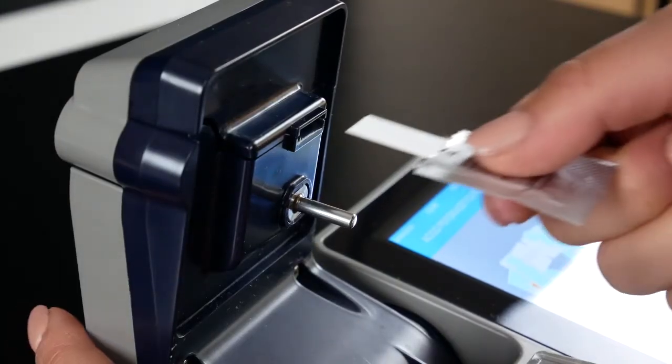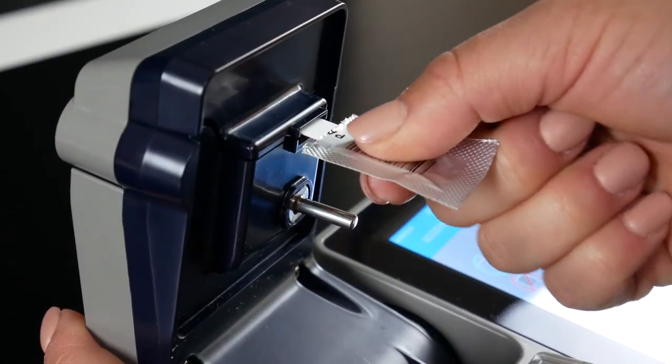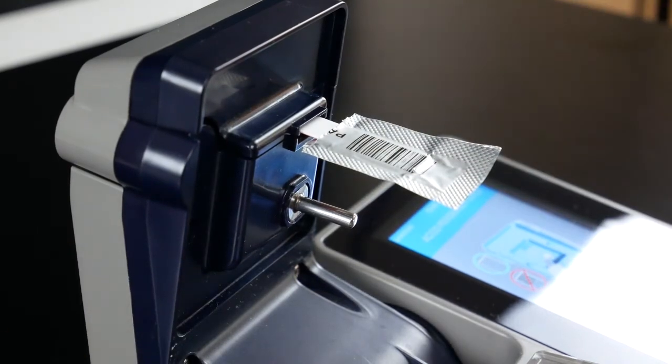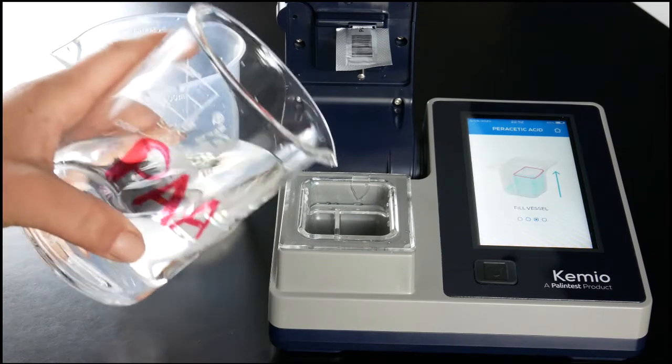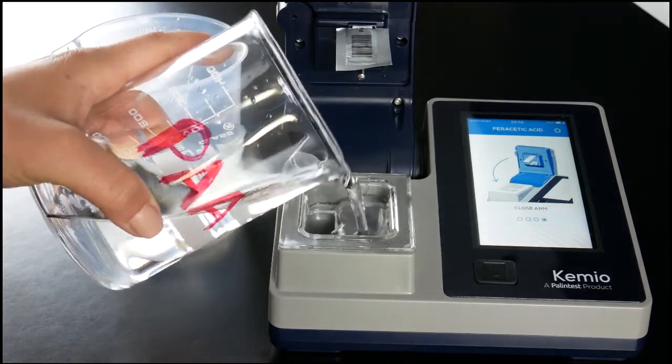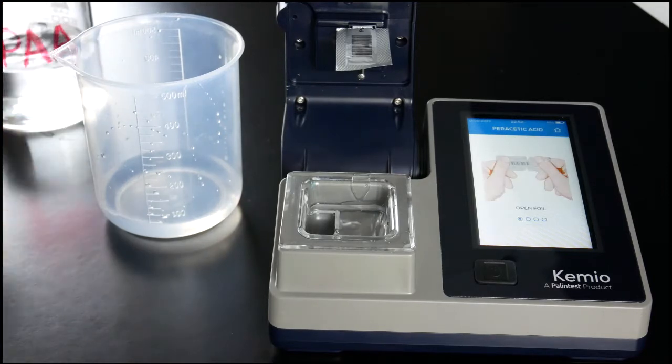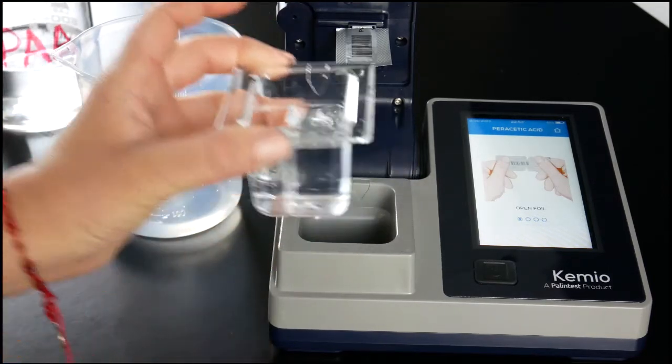We can now insert the sensor with the contacts face down. I suggest you leave the foil on for now. Next, use your sample to rinse the vessel.